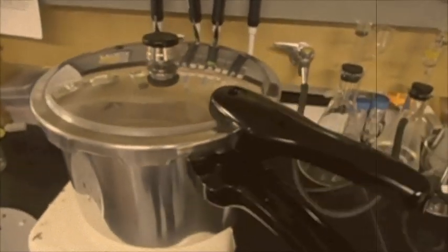We will be using a hot plate and a pressure cooker as a heat source because it can reach temperatures high enough for sterilization.